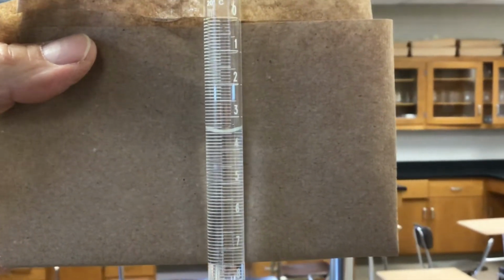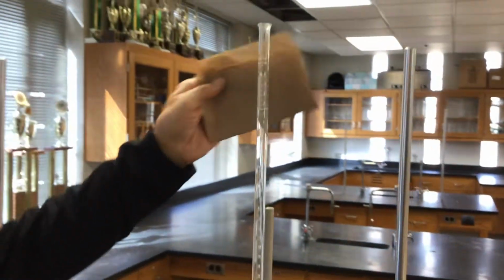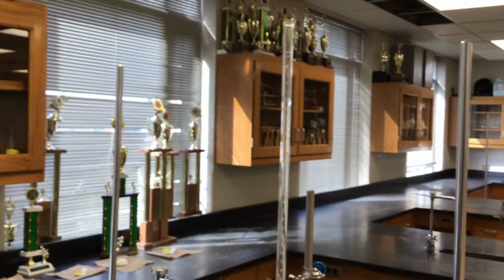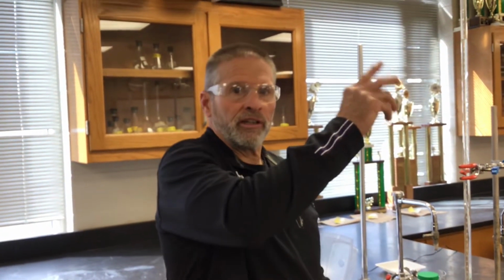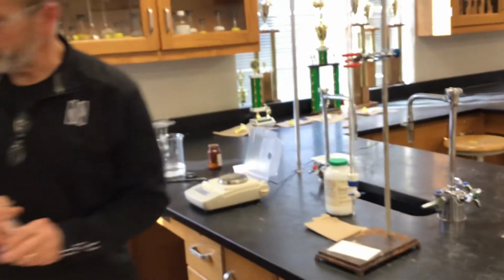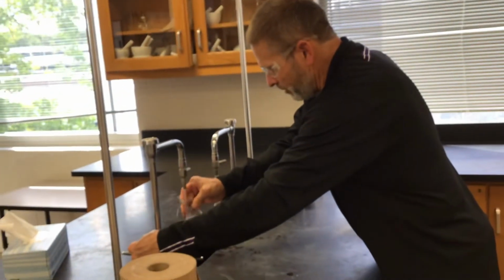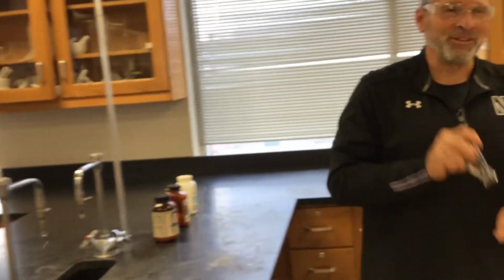Okay, so we had the mass of this unknown acid, and I don't know if we put the camera on it, the volume was 0.00 at the beginning of this trial. We set that before we did our fast and sloppy trial, and then we refilled it and you set it right to 0.00. We didn't show that, but we did it. Chemists never make mistakes. Trust us.